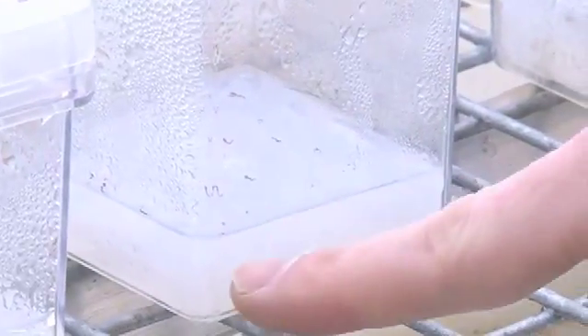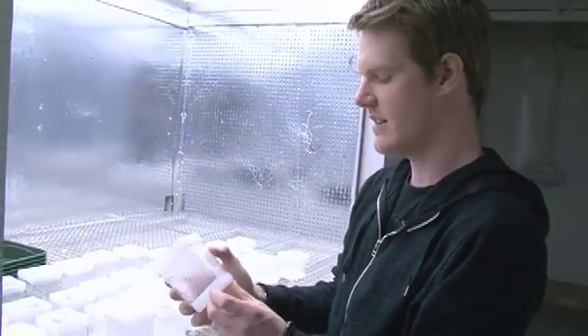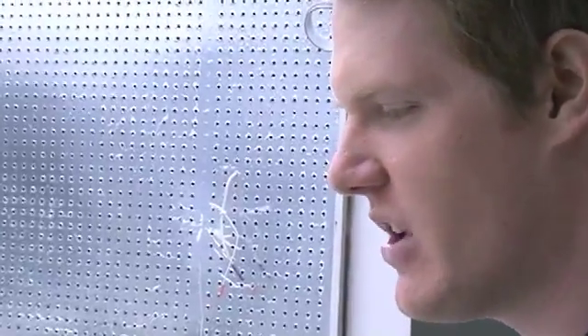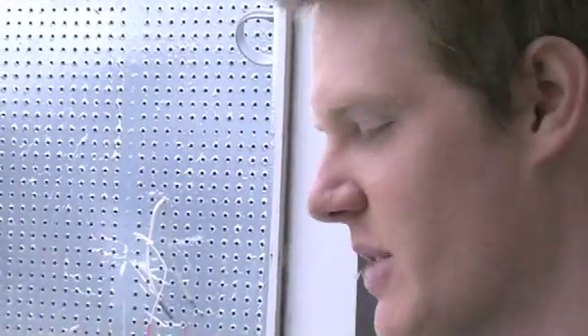I've put them on a little layer of agar, which ensures virtually 100% humidity — as you can see on the sides. It keeps them nice and humid but there's very little nutrients in the agar; it's simply to germinate. Once they've germinated and they get these little leaves called cotyledons, they need to be taken out as soon as possible because they're desperate to start photosynthesizing. I only actually need 250 but I put out 1,050 just to make sure I got enough.